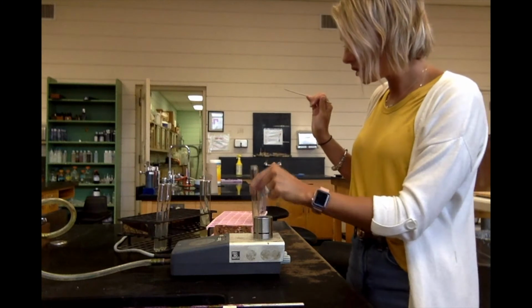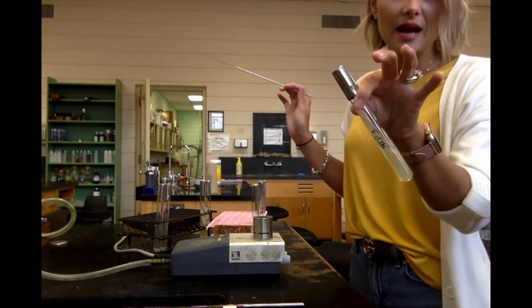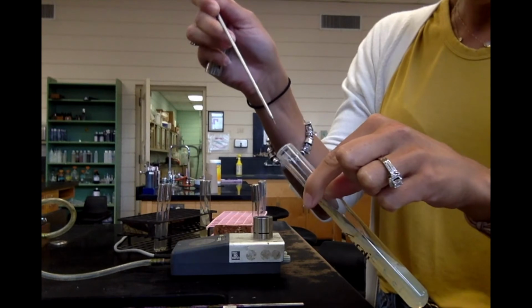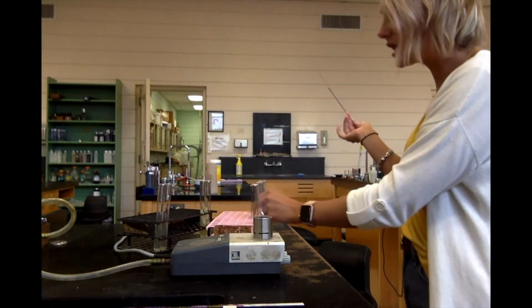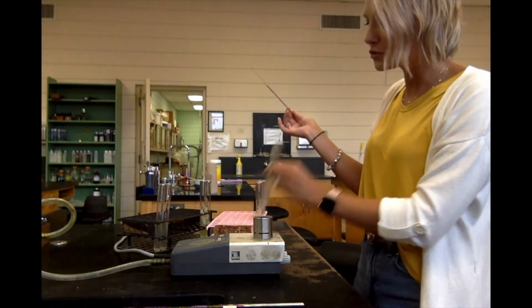So that's my stab. And so I'm just going to use my slant, okay, to get the bacteria. This is E. coli. So I'm simply going to glide across the top of the slant, just like that. It doesn't take a lot, okay? We're going to let this incubate for 24 hours, so the bacteria is going to grow and produce colonies.